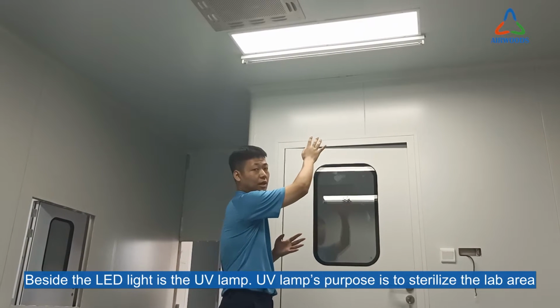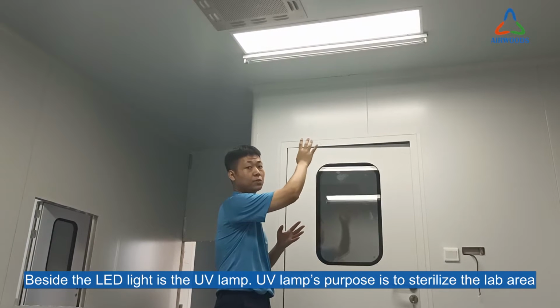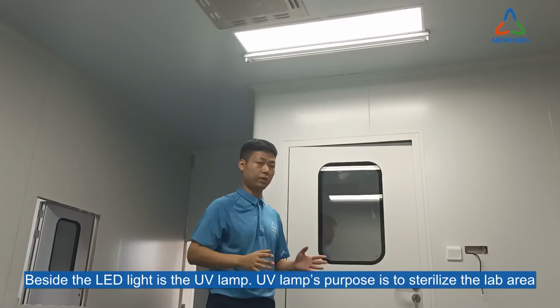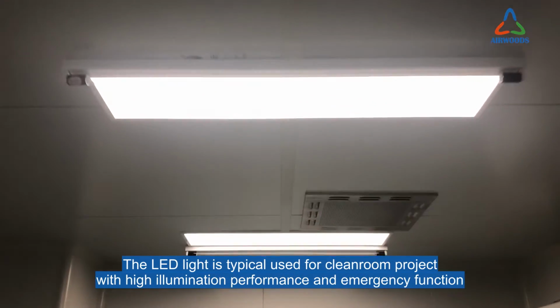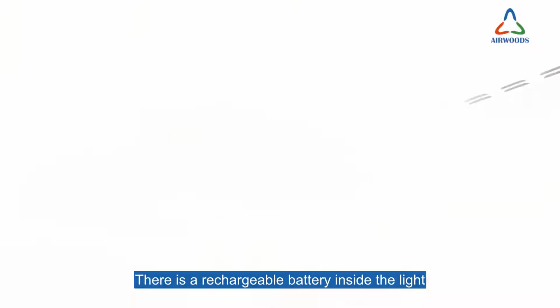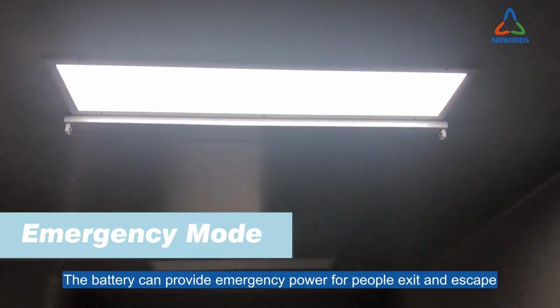Besides the LED lamp, there is the UV lamp. The UV lamp's purpose, as we know, is for sterilization of the lab area. The LED light is typically used for cleanroom projects with high illumination performance and an emergency function. There is a rechargeable battery inside the light. When the power shuts down suddenly, the battery can provide emergency power for people to exit and escape.